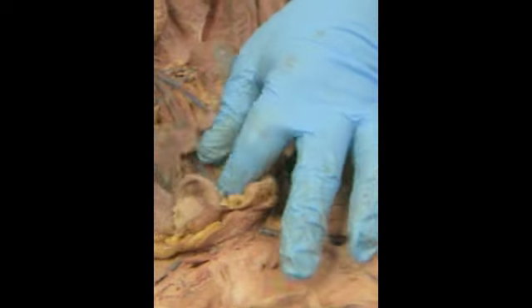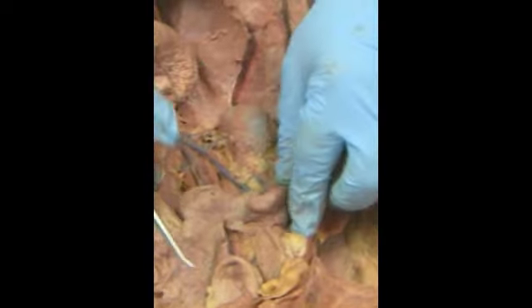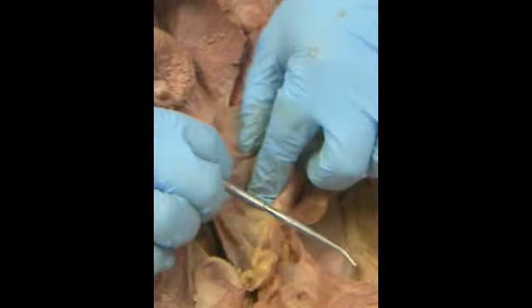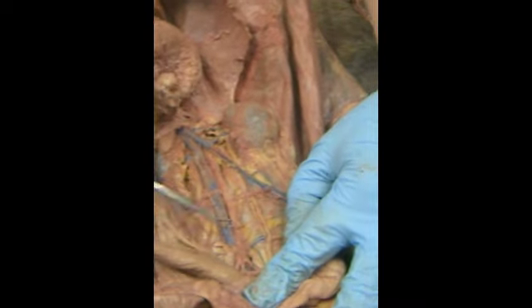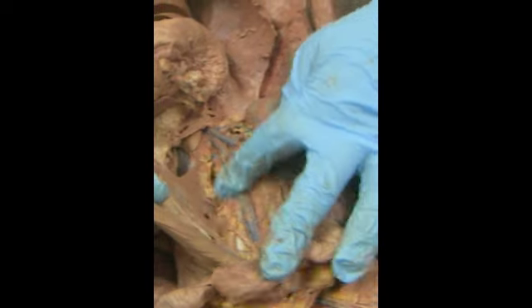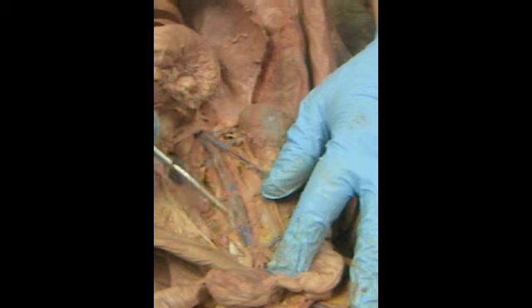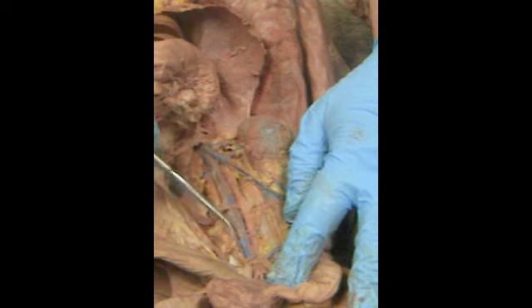If we come up in here, we're going to see two V's, external iliacs and internal iliacs. Moving our uterus, which just gets in the way. We also see coming straight across here the iliolumbars. There should be, and it got broken, one that comes straight up. That would, oh, that's the genital.